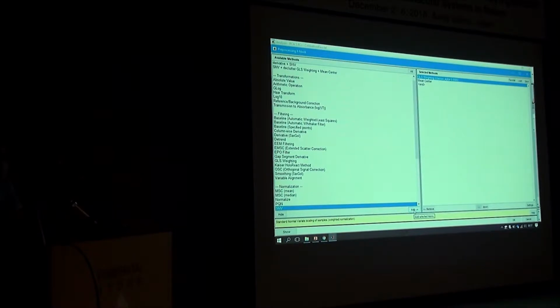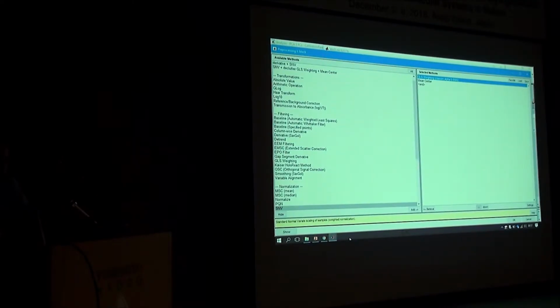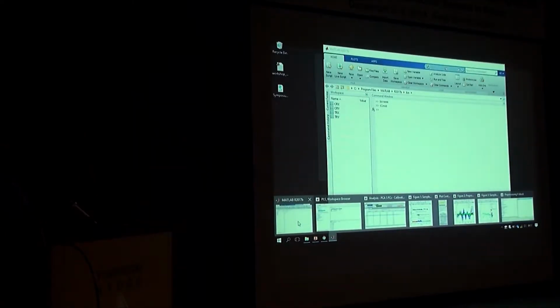Yeah. Just the MATLAB script that you provided, this is the data, or I'm confused about what is in the MATLAB script, the data? There's no MATLAB script. There's a data set and there's this program. Okay, that's right. But you see there's tedious clicking and opening this window and zooming, you can automate all those by MATLAB. In the PLS Toolbox version, which is the MATLAB version of this. If you see, I have the MATLAB in the background. So you can program all of this.